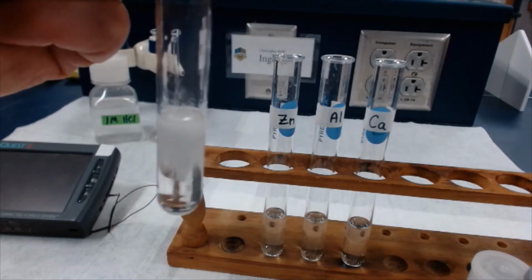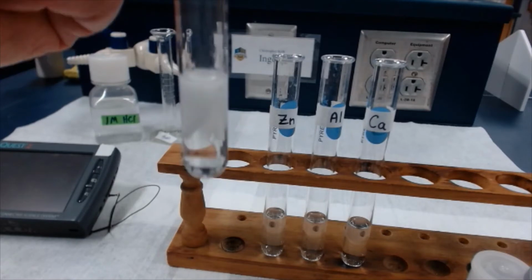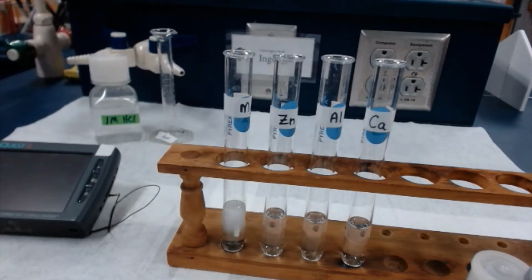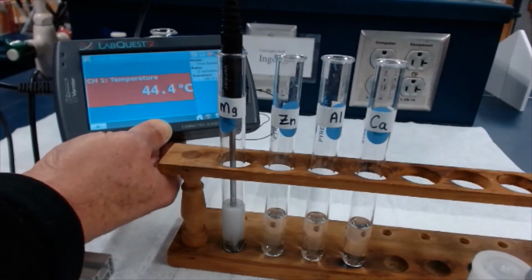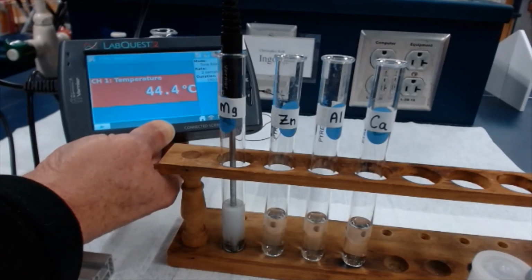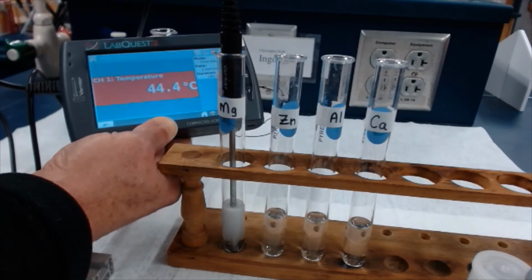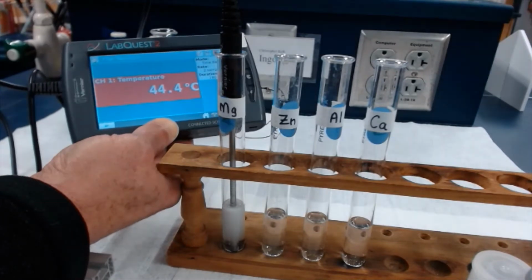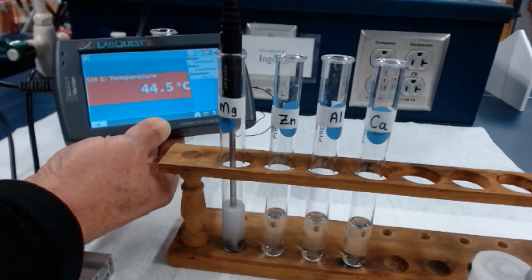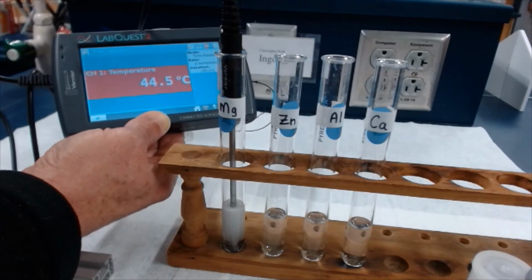Now that you've seen what's going on with the magnesium and the acid, I'll stop the video and come back in another minute. That way you won't have to just sit here watching the same reaction. I'll come back. Class, 3 minutes has elapsed, and the directions say then to take the new temperature of the acid and magnesium after reaction, and you can record on your lab the temperature, 44.4 Celsius. So it went up from 18.6 or 18.7, something like that. So a considerable increase in temperature. All right, we'll move on to the next reaction, zinc plus hydrochloric acid.